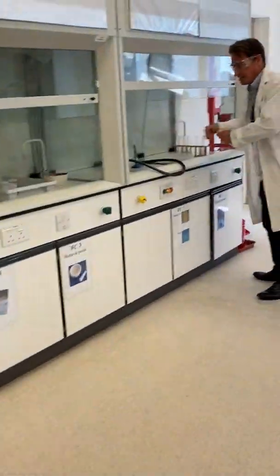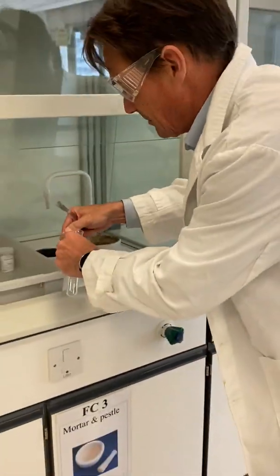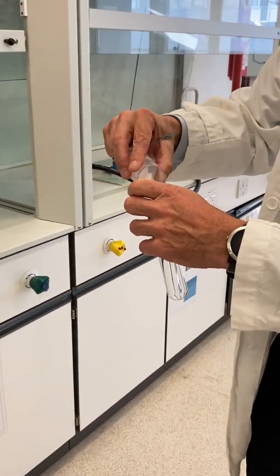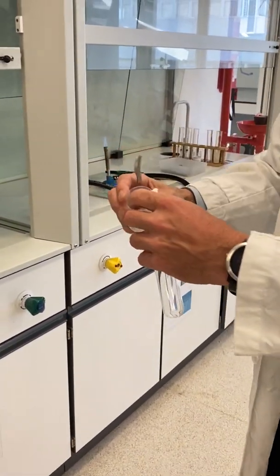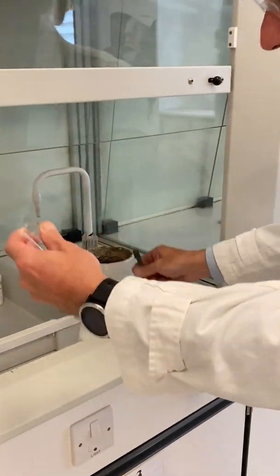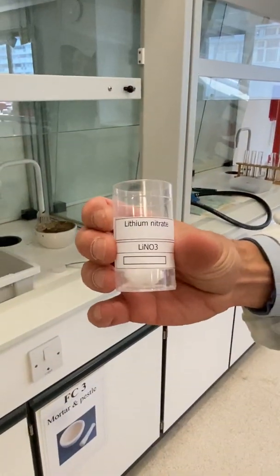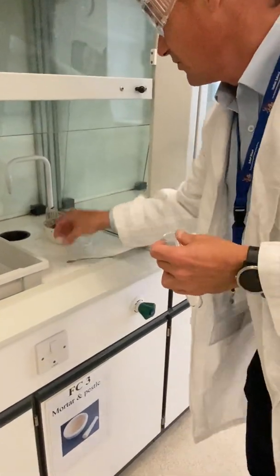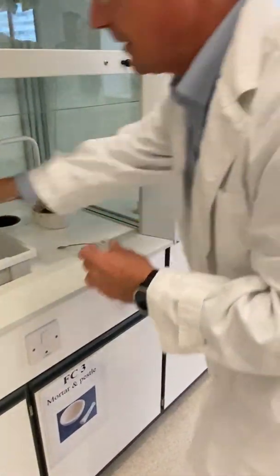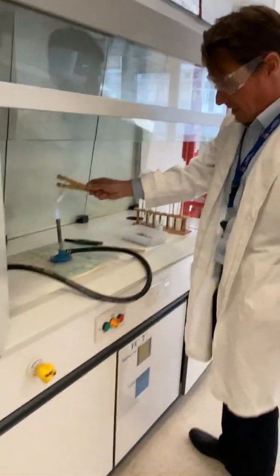Getting another test tube prepared here — we've got some lithium nitrate. Again, this is a hydrated form. Just ram it in there. So we've got some lithium nitrate there. Put the top back on.